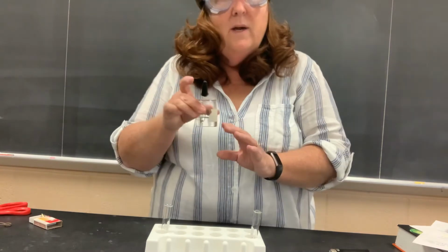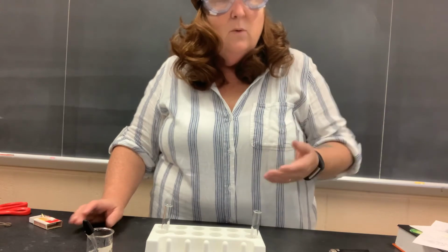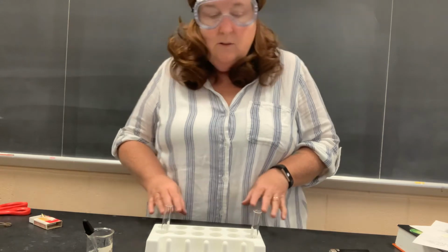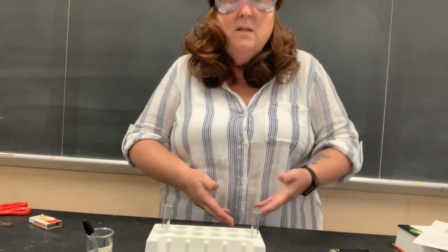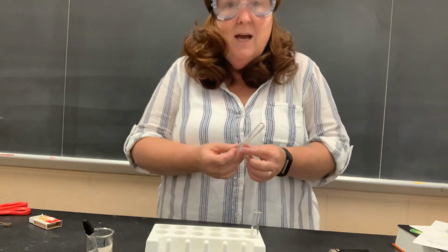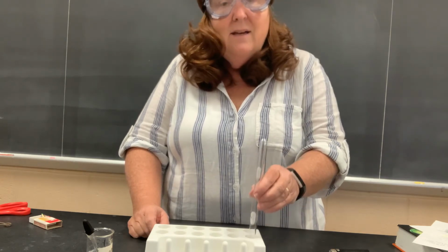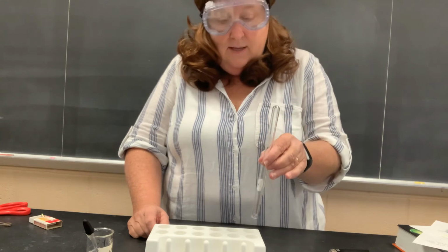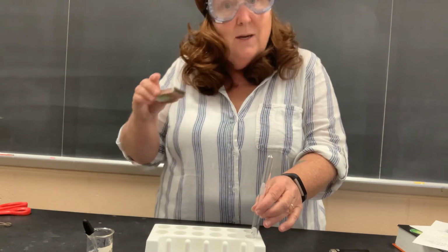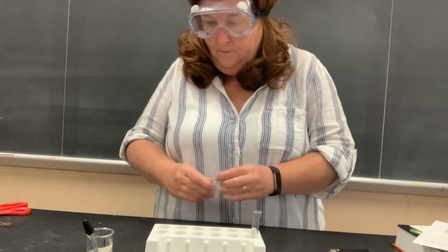And here I have some 6 molar hydrochloric acid. It's a fairly strong acid. And I'm going to put that into my test tube and I'm going to see if a reaction occurs. Remember, a reaction occurs if there's a large change in the substance appearance, if energy is given off. So if I feel heat, if I see a gas being given off, those are usually signs of a chemical change. At the same time, I'm going to take my second test tube and put it on top of the first test tube and trap the gas that is forming from this, because I know what's going to happen. And then I'm going to also try to light the gas with a match when I'm done doing that. We'll see if I can do this just as one person.